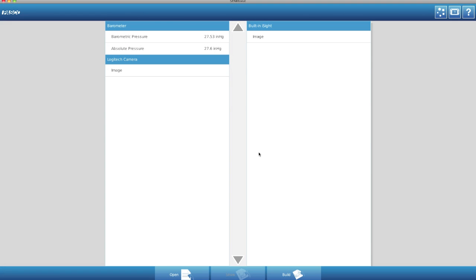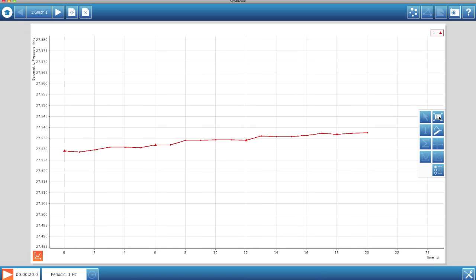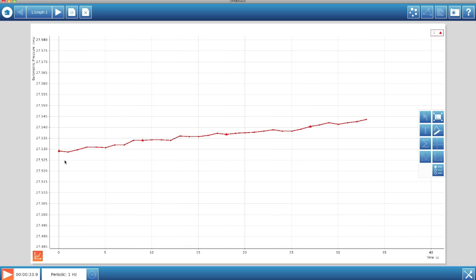Okay, here we are at the computer and we've plugged in and we're going to select our barometric pressure reading and we're going to show that and then we're going to click start and we should get some pressure readings right up right away. And at first glance, it will look like the pressure is not changing at all, but what we're talking about here is very small pressure changes. So what we're going to have to do is bring up the auto-scaling of this graph. I'm just going to click auto-scale. And this is the beauty of using a sensor: we just wouldn't be able to see these kind of results using traditional equipment because these sensors are very sensitive. We're talking about changes in barometric pressure in 100ths of inches of mercury.